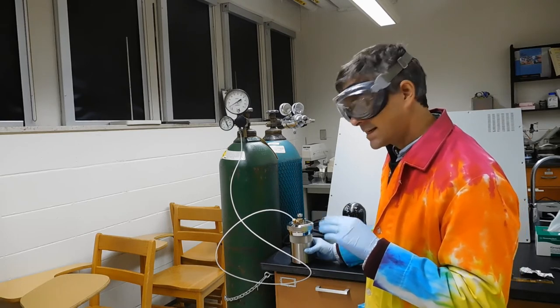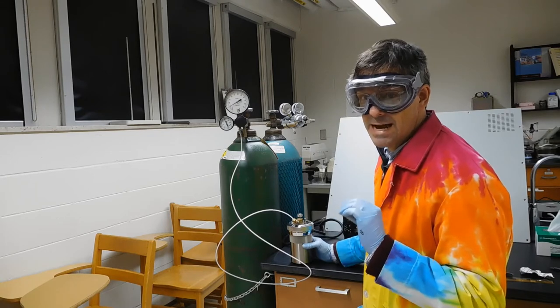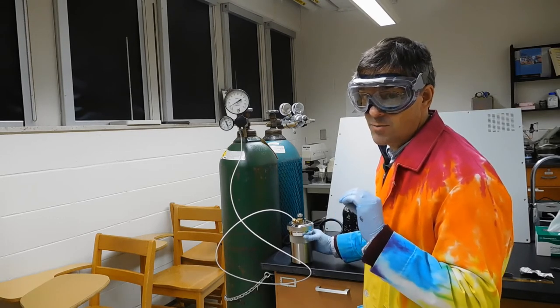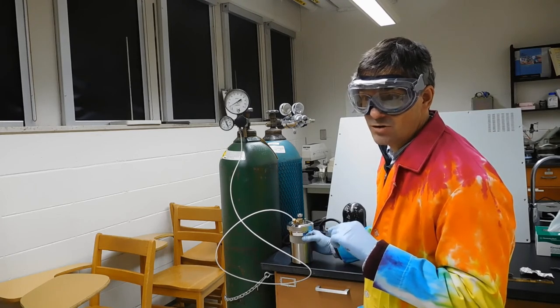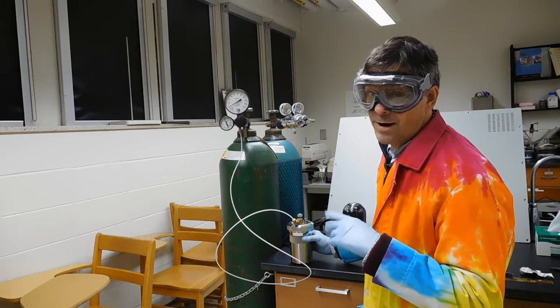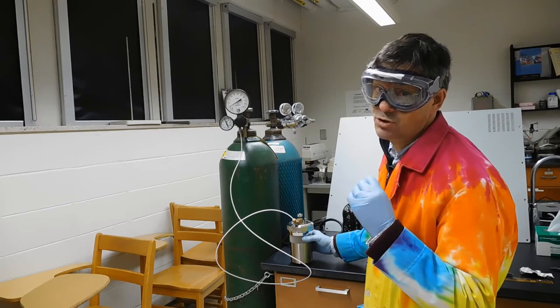Now, as I said before, it's really important not to do this wrong. If you put too much pressure in here, the bomb could rupture, and that could injure you, or it might rupture when you set off the reaction, which is going to increase the pressure some too, so you have to be careful not to do that.